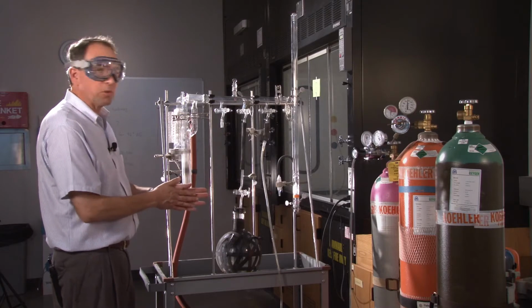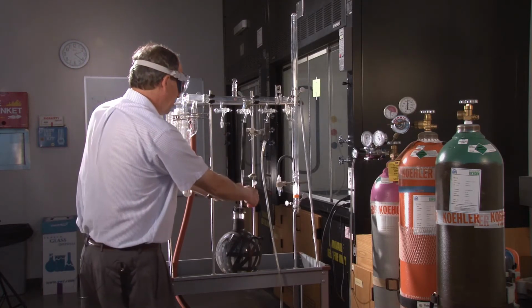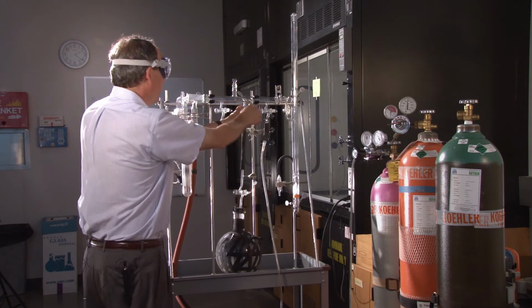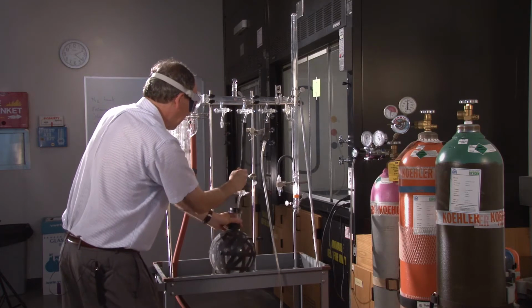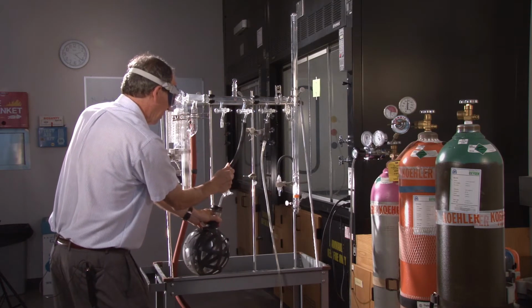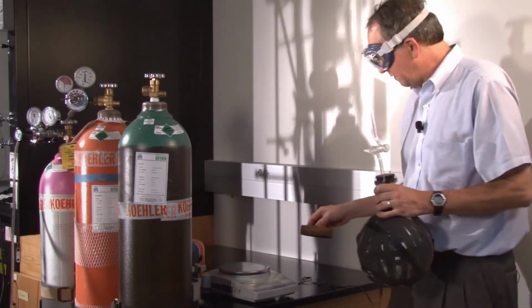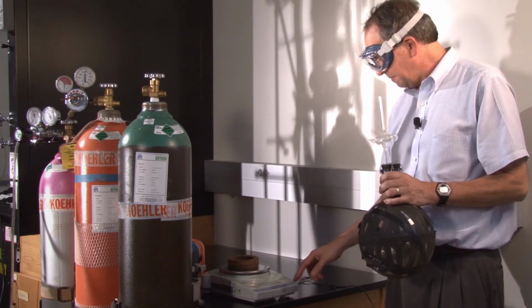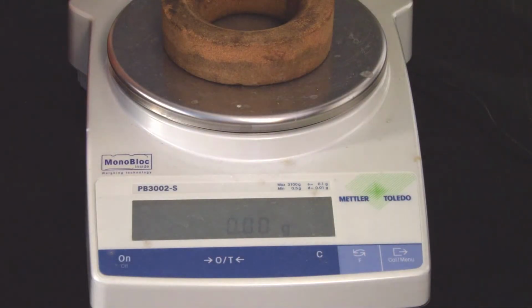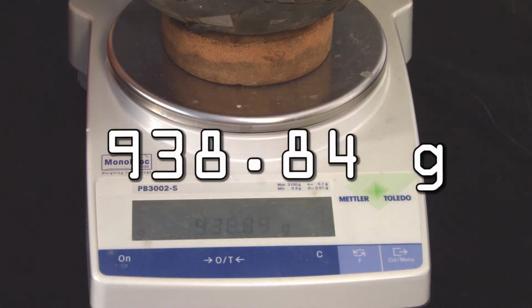Now what I'm going to do is shut off the valves and disconnect the evacuated sample bulb from the gas manifold. All right, now we're going to weigh the evacuated bulb. We start by putting the cork ring on, zero the balance, and this should be the mass of the evacuated bulb.